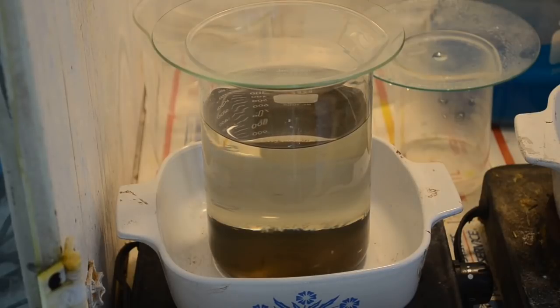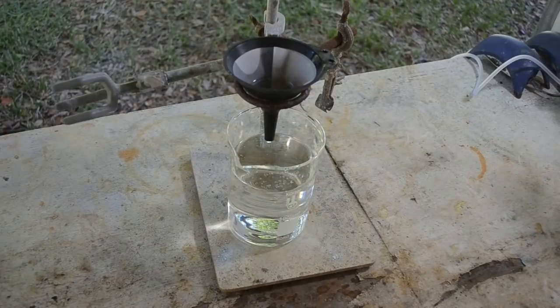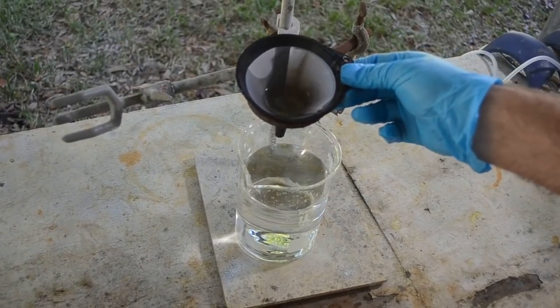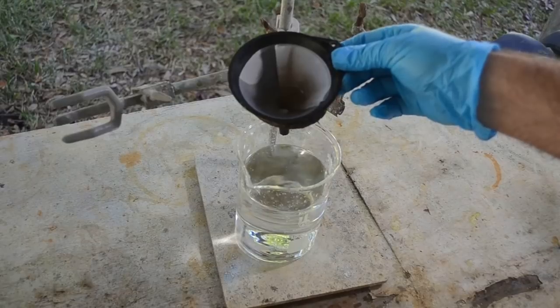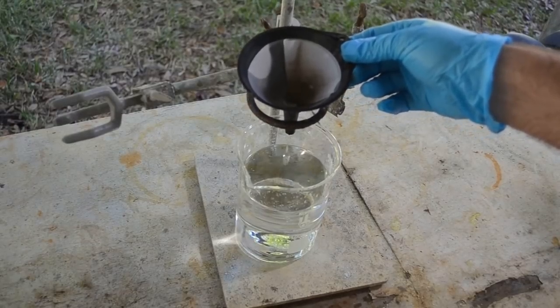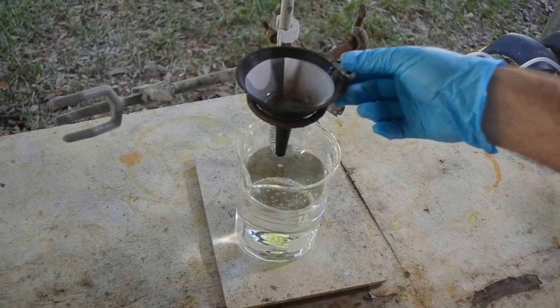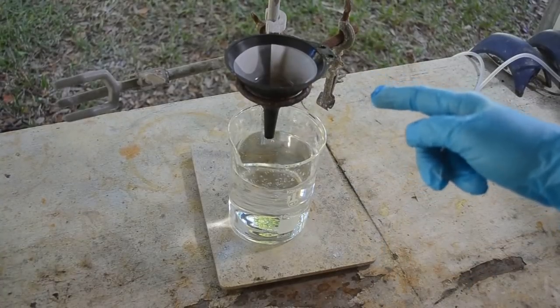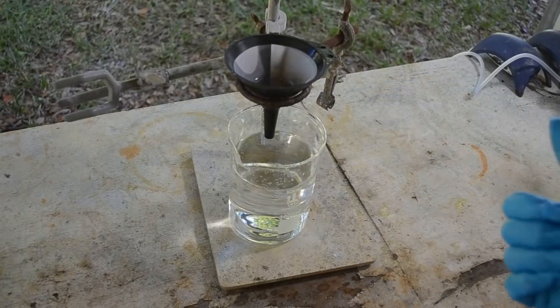It's Christmas Eve. And we're going over to some relatives' house in a little while, but I can at least get started on it and maybe finish it up tonight. We'll see. Alright, I have drained all the liquid off the gold, and I don't know if it's showing up there, but you can see there's a little bit of gold made it into the filter. Not much. But I'll let this go for now and let that continue draining and leave this out here because I've got the gold in the fume hood.